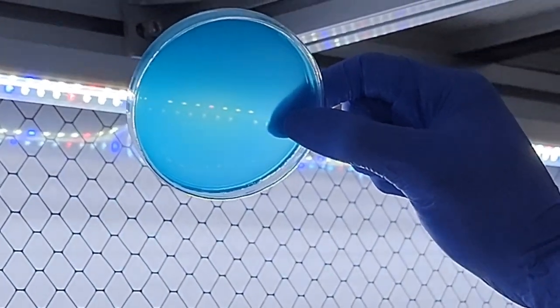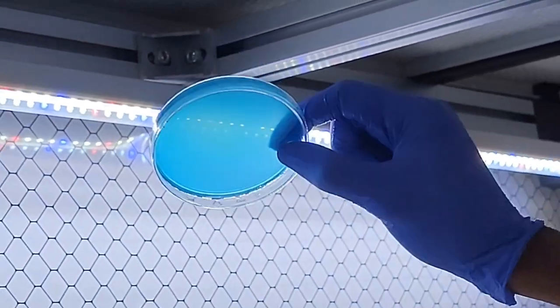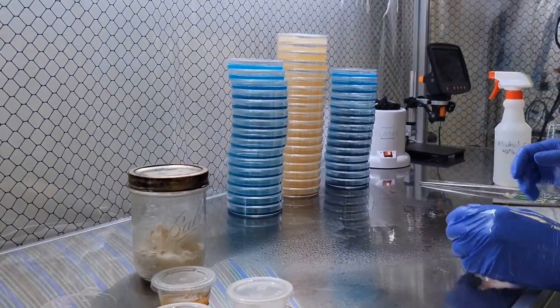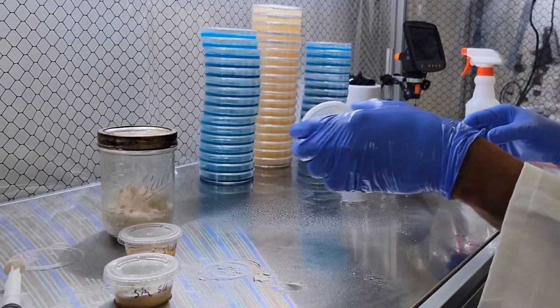Looking pretty good. A little foggy but you know. Nice. So let's start with an easy one.